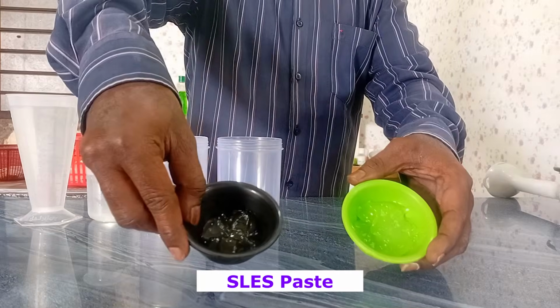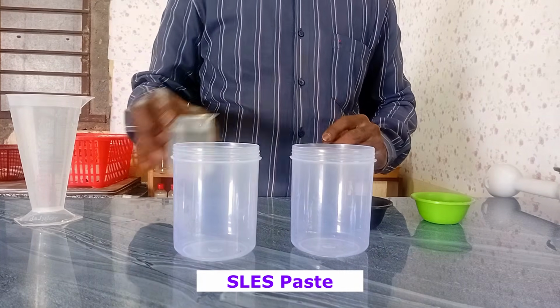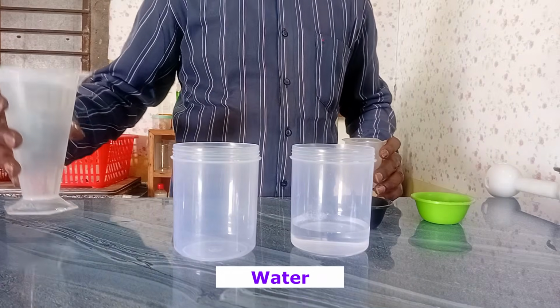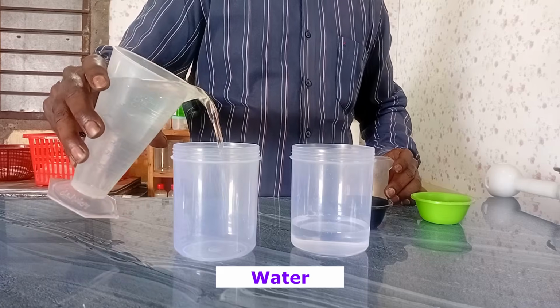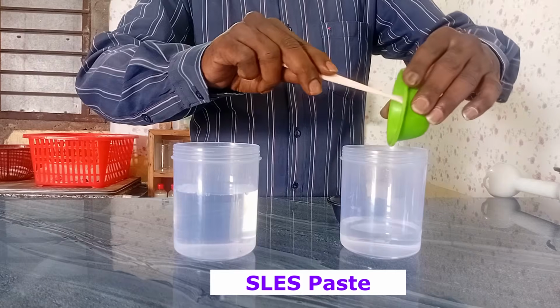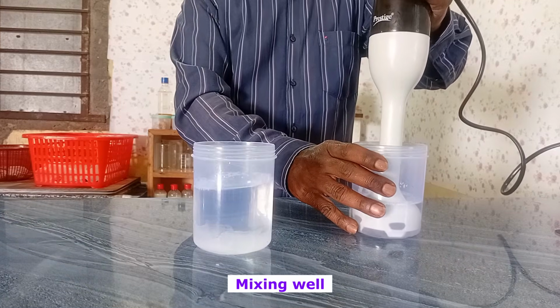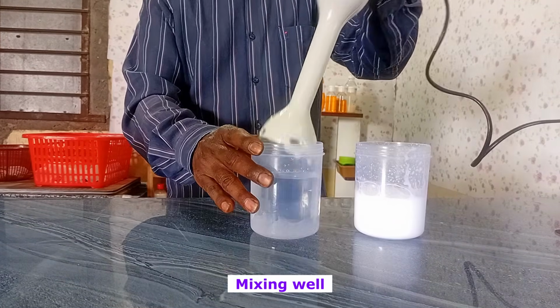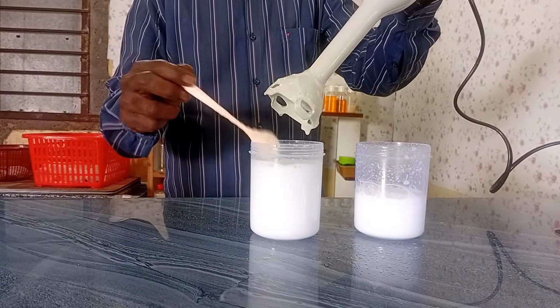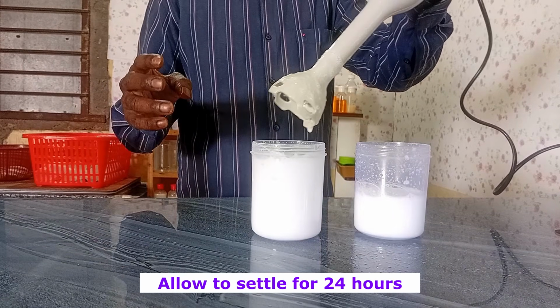I am taking 20 grams of SLES paste. Of course, two samples. In the first one, I am taking 100 ml water and dissolving. In the second one, I am taking 200 ml water and dissolving. I am mixing well. Now it is a white color medium because SLES is a foaming compound. So we will check it out after 24 hours.